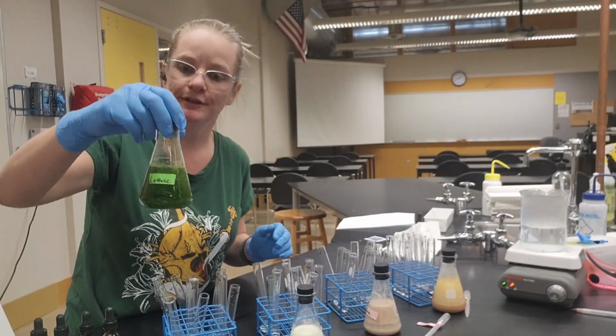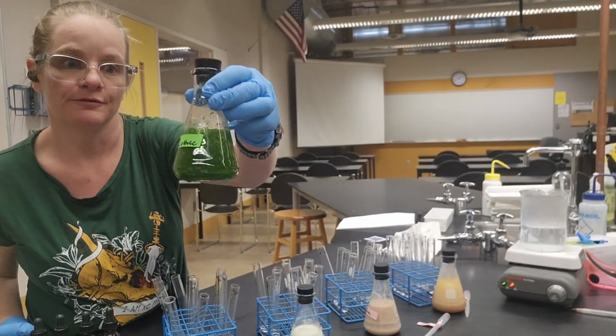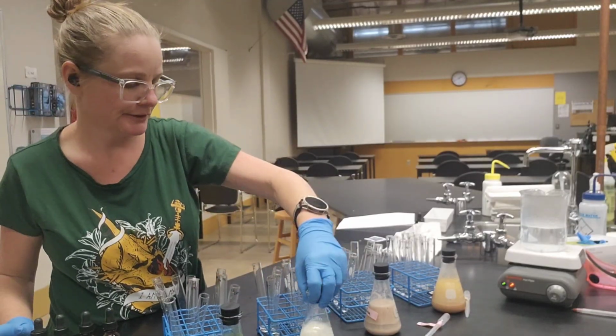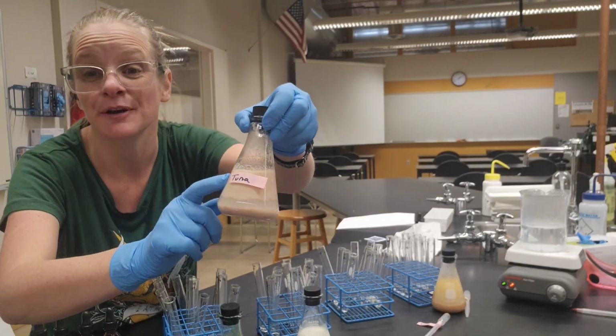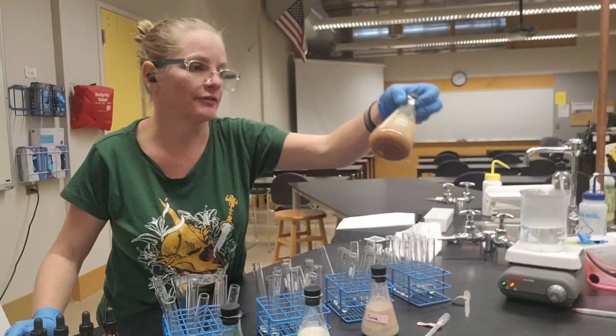Our lovely prep team went ahead and blended up the foods that we're going to test for. So here's our lettuce. It looks real chunky. We've got some milk. We've got some tuna. This is why you're glad that you're in an online class, because you don't have to smell this. I do. You're welcome. And then we've got some refried beans.